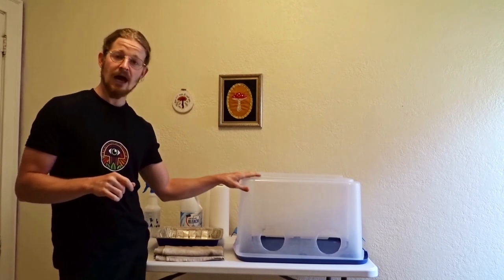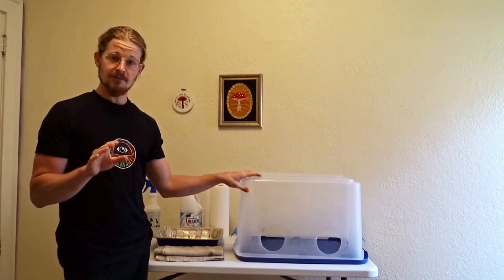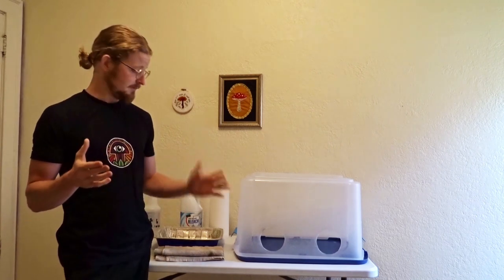This technique I used when I first started cultivating from the bathroom of an apartment with four other guys. It was not a clean environment, not a pretty sight, but because I used this technique, I had no contamination issues.